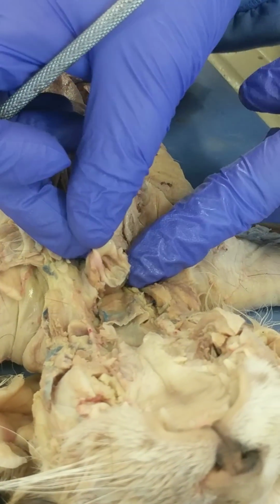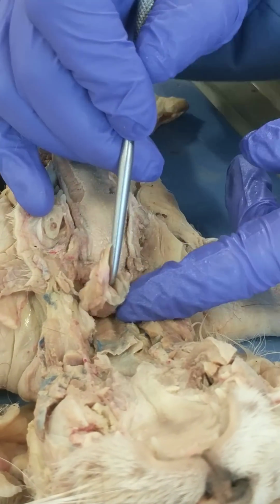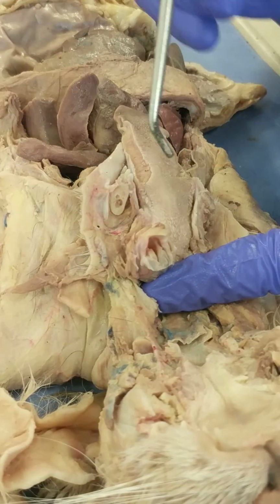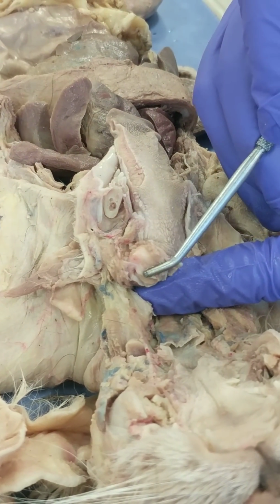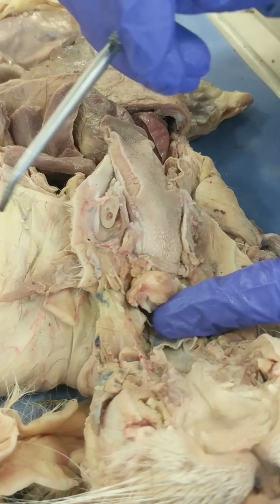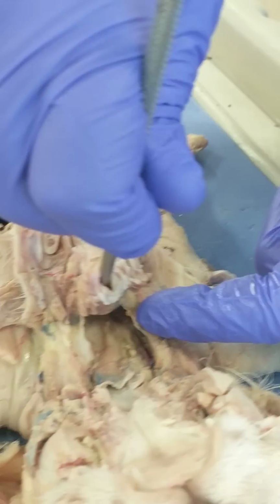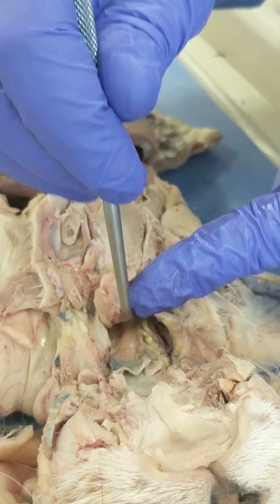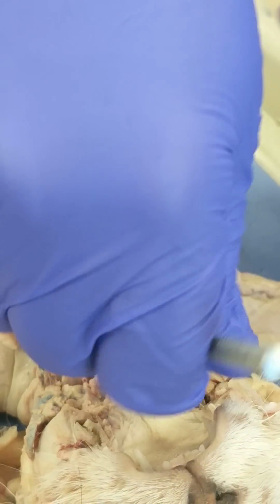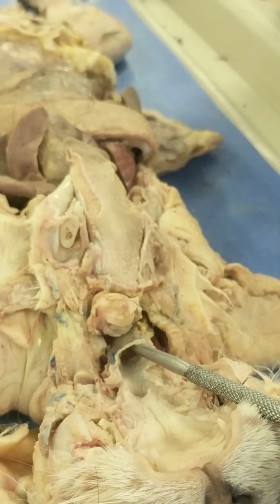So first I'm going to show you the opening to the respiratory system. The hole that I'm trying to pry open there, can you see that okay? Is called the glottis. And it's covered by this cartilage called the epiglottis when food is swallowed over the tongue. So this glottis leads to the larynx, or the airways, to the respiratory system. Dorsal to the larynx is the opening to the esophagus, which you can see right here. And we'll identify it again as we go down through the neck.